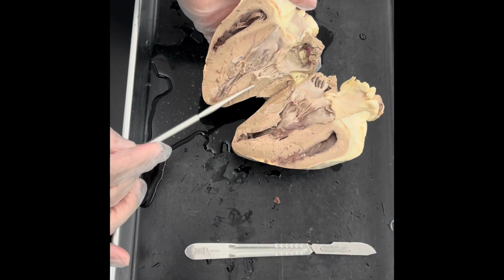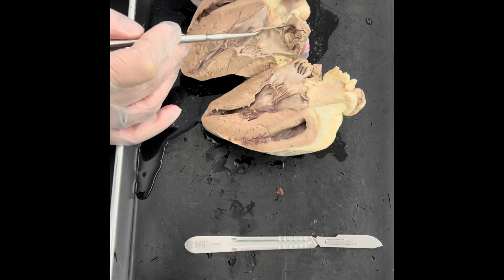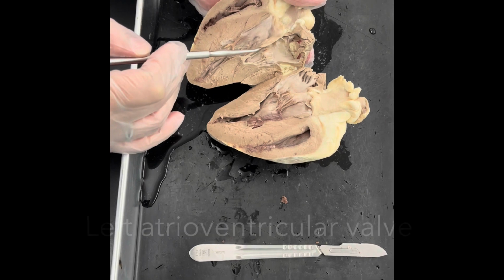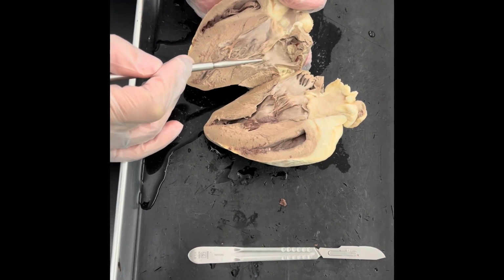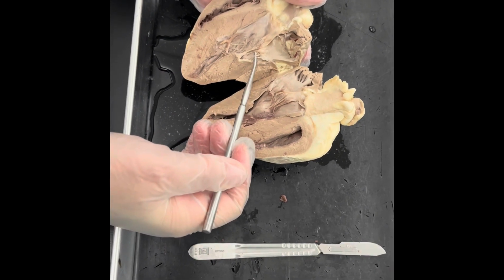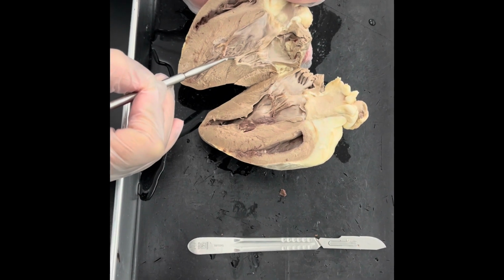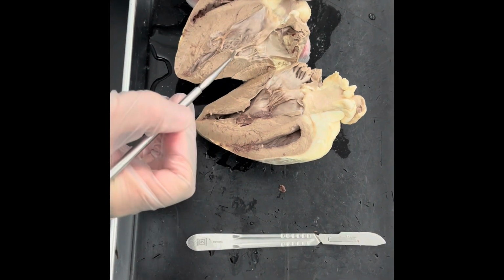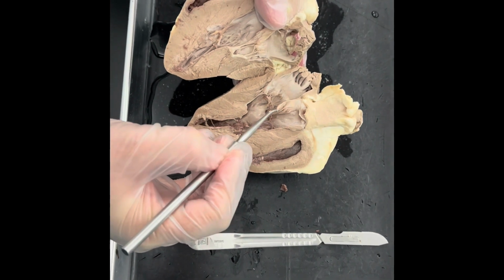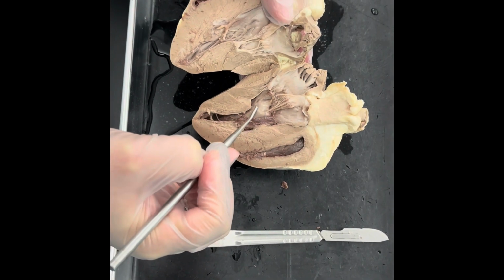You see that wall of the heart. So another thing you're going to see is the valves. So for example, this right here would be the bicuspid valve or mitral valve, also known as the left atrioventricular valve, with the chordae tendineae right there. Kind of looks like a parachute, right? And then this right here is one of the papillary muscles attaching those chordae tendineae. You see it on the other half. This is the other half of the valve right here. This is the other chordae tendineae and another papillary muscle right there.